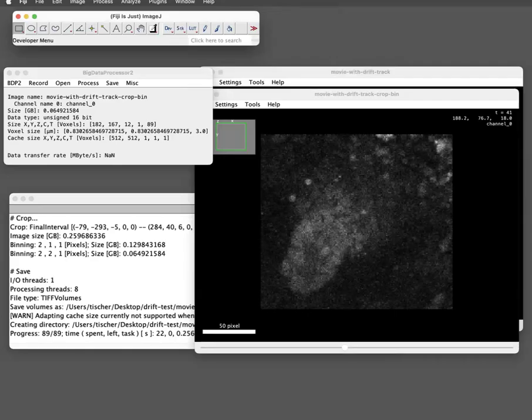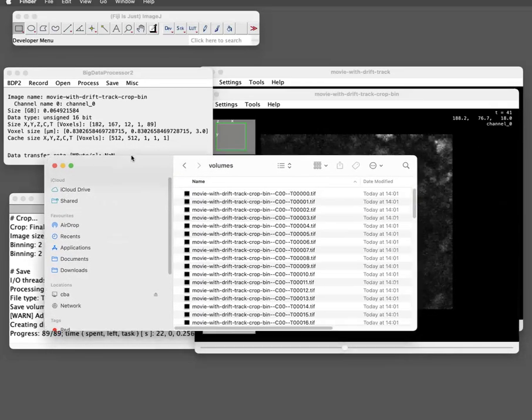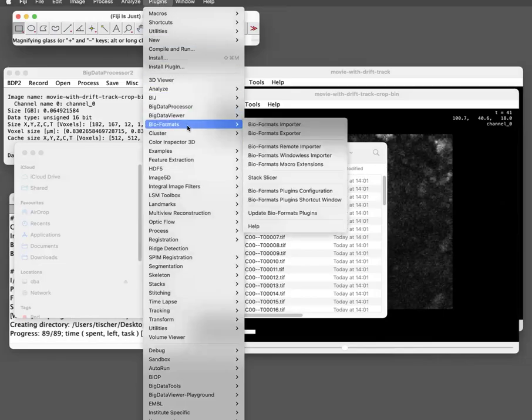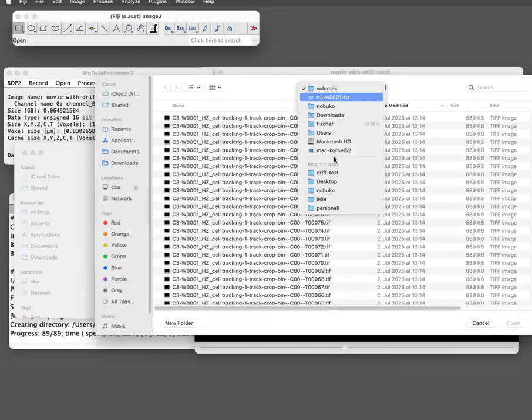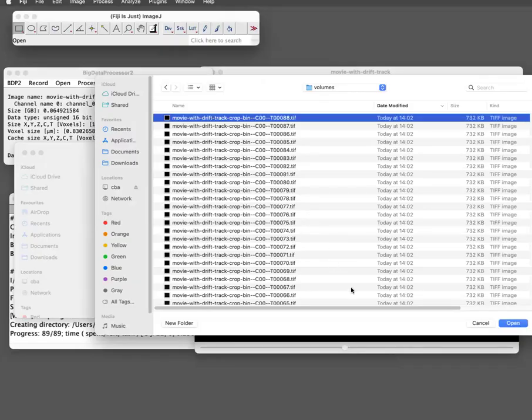Because, I mean, maybe I just show you first how the data looks like. So this is a file format where for each time point we have one Z stack, okay? And they are labeled. So opening them in FiJi is actually quite easy. It's a very handy trick. Plugins, bioformats importer. And then you just click on one of them, doesn't matter which one.